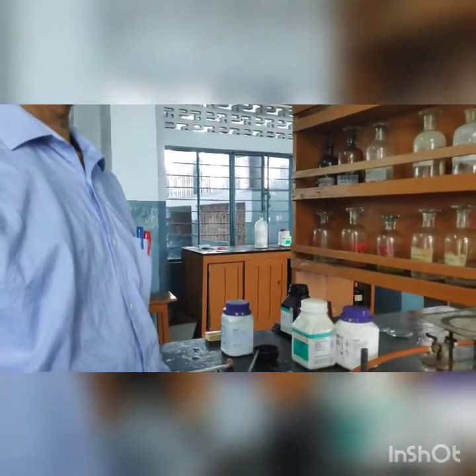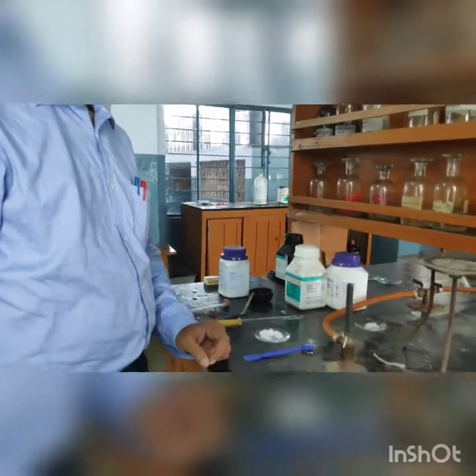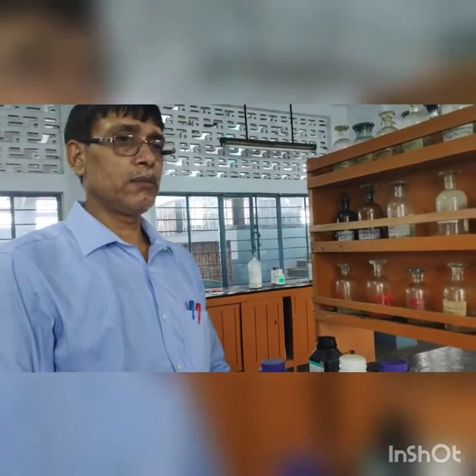With this we will end the demonstration of anion identification — however, the acetate ion is still to be tested. For the acetate radical: we collect the soda extract of acetate, then add ferric chloride solution, and we get a garnet-colored precipitate. This is the confirmatory test for the acetate radical.